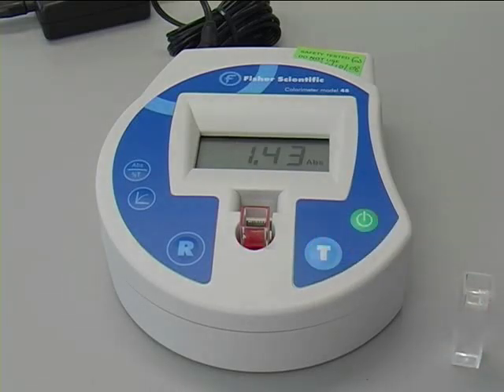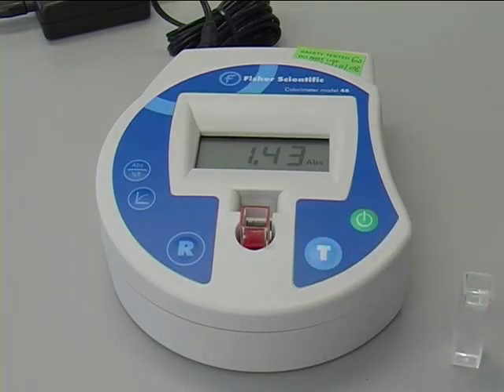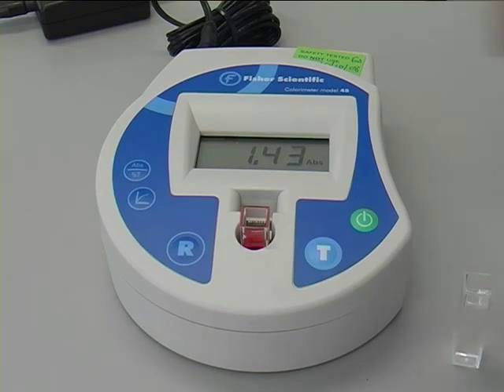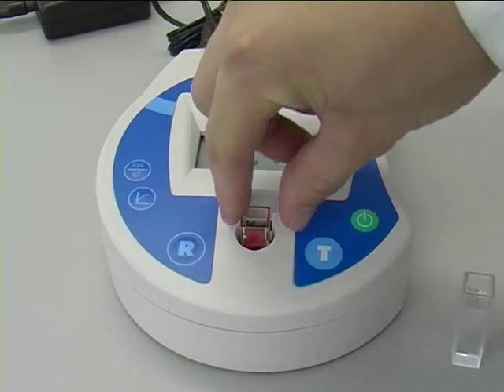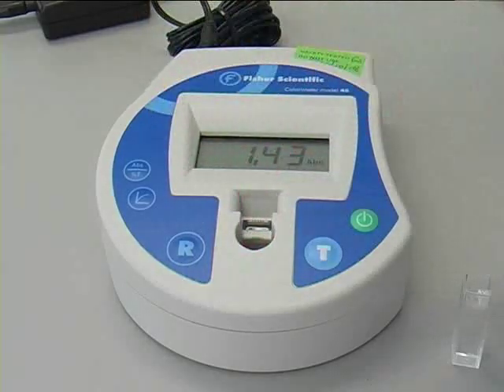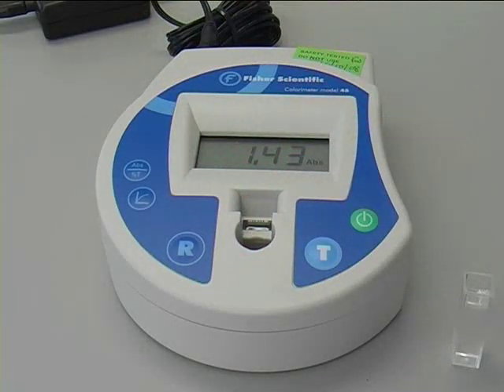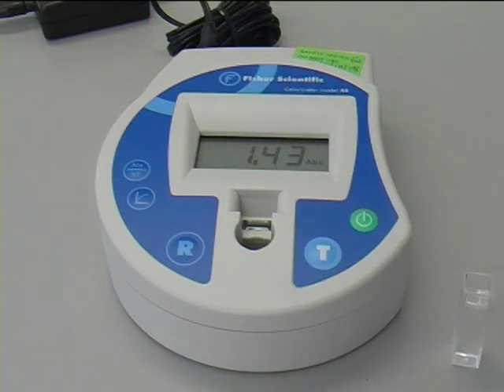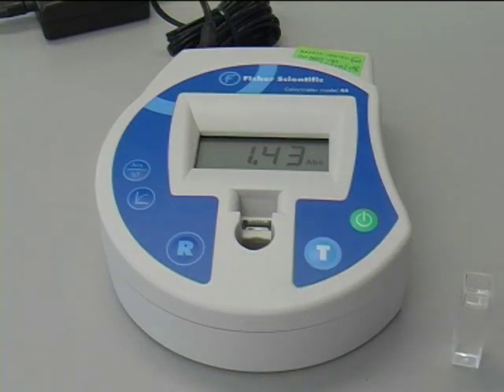Note that if the filter is changed then the colourimeter must be re-referenced. However, if you are simply measuring the absorbance of multiple samples using the same filter, then it is not necessary to re-reference between readings.